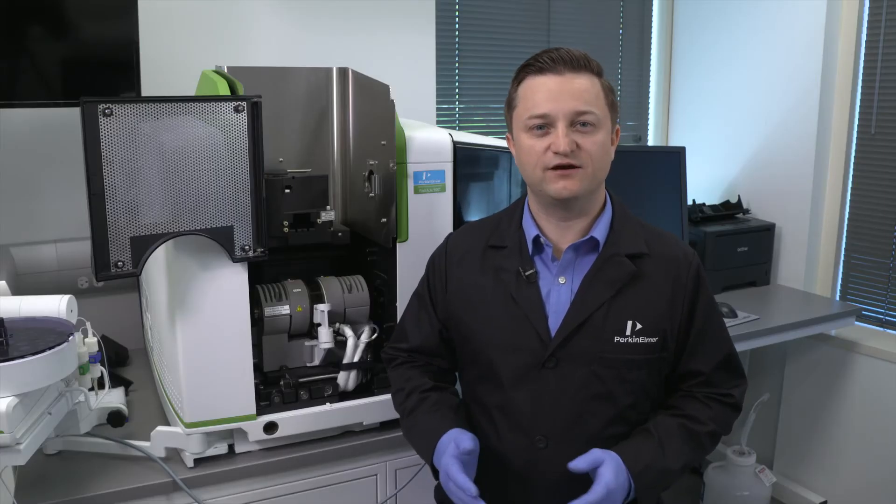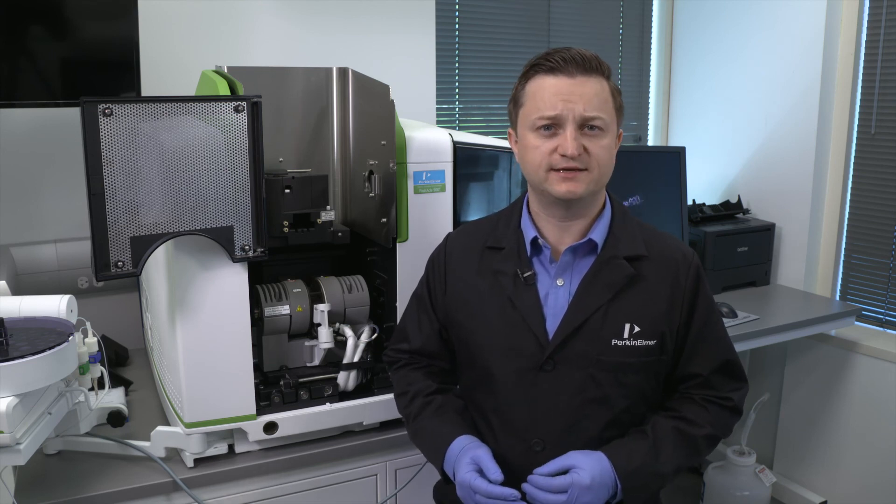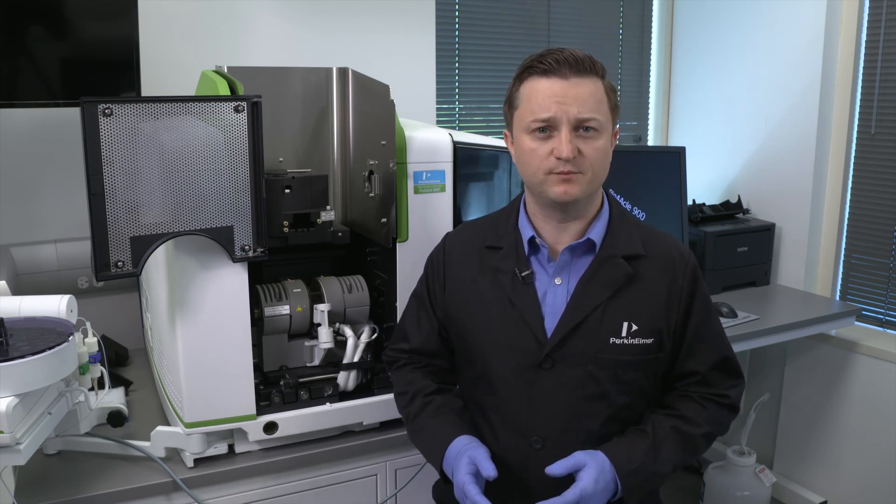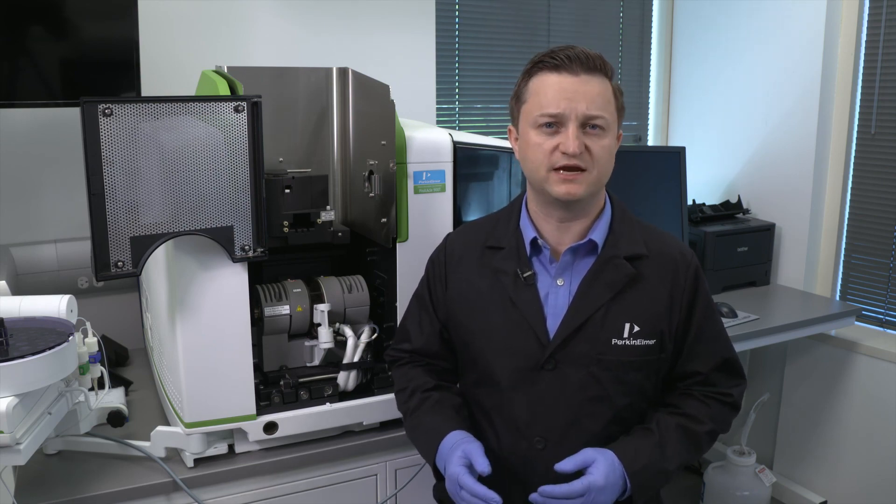Your manual and these how-to videos are great resources to get familiar with the AA system. For more in-depth information or additional training options, please reach out to your PerkinElmer representative.